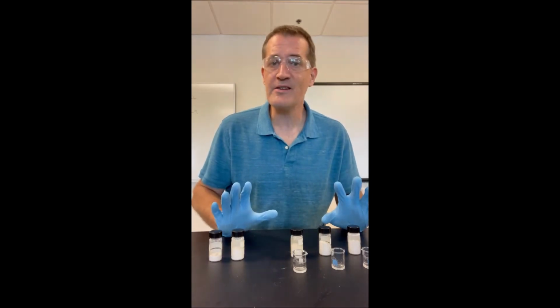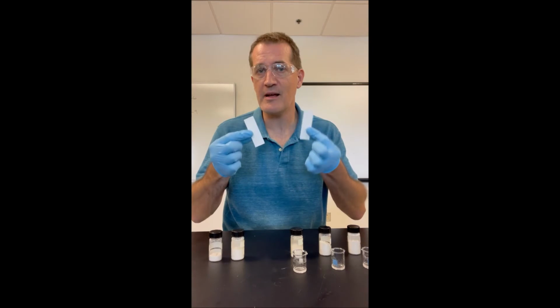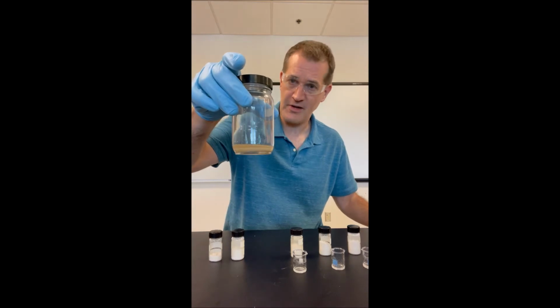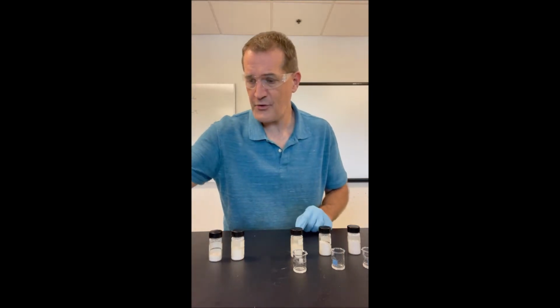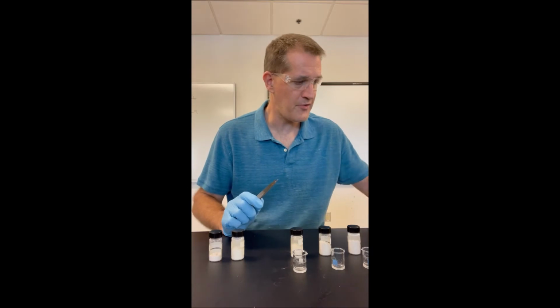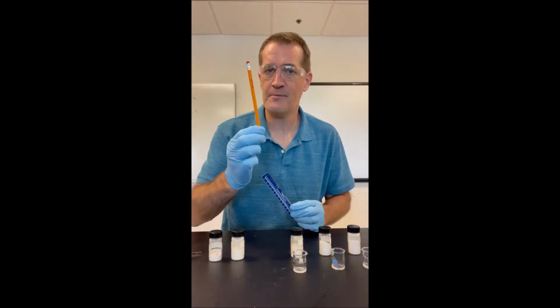The other things that we need to complete this experiment are a couple of TLC plates, and I'm going to give you some more detail about preparing these in a minute, and this TLC jar that's got some sand and some TLC solvent in the bottom. We'll also need a pair of tweezers. There is a UV lamp that's somewhere around here. I'll show you guys that too. We'll also need a ruler and a pencil, all right?